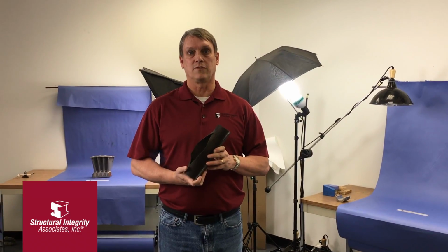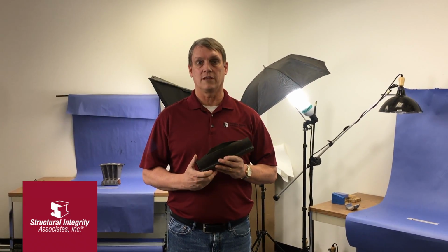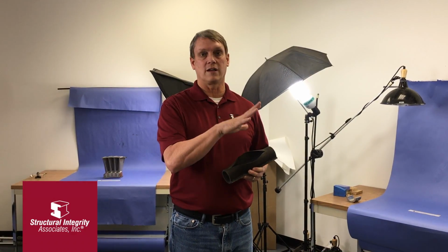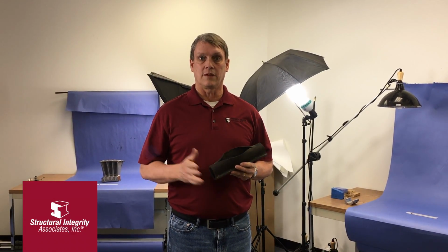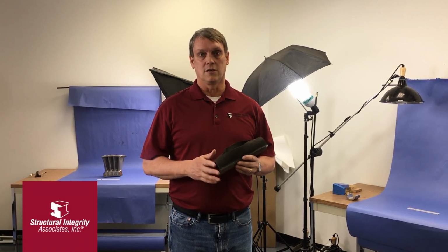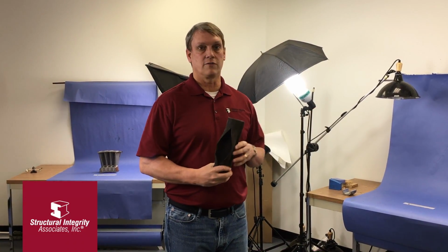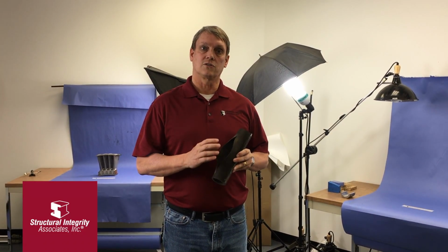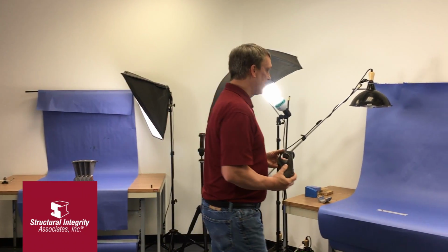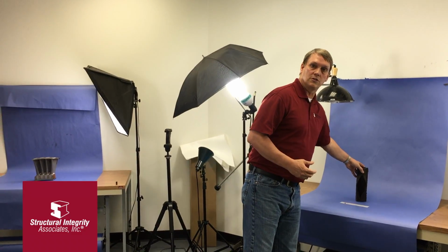One of the early steps of the failure analysis process involves documenting samples in the as-received condition. For larger components or samples, we normally do that in the shop where we have a lot more space. But after samples have been cut down, or in the case where we receive smaller samples initially, we can take pictures here in the photography room. Normally what we're doing here is trying to document features of interest, which might include fracture areas, areas on the samples where there's corrosion, mechanical damage, wear, or features of interest that might indicate something that's associated with the cause of failure.